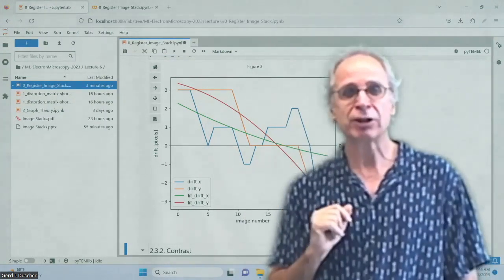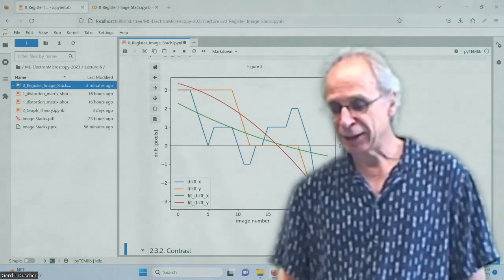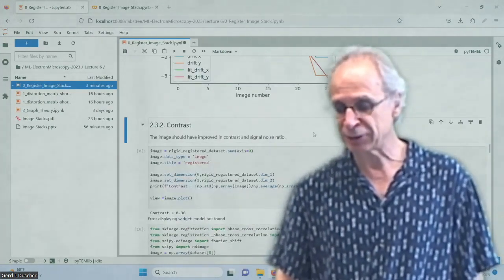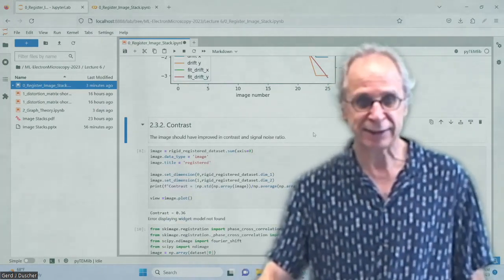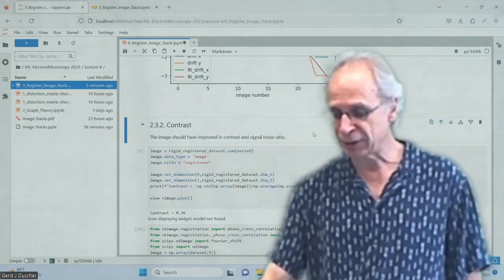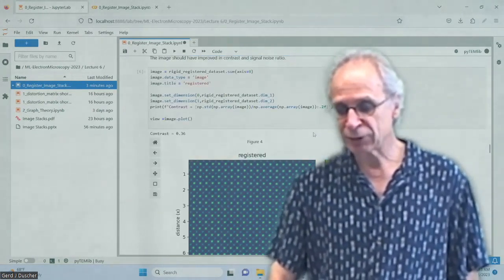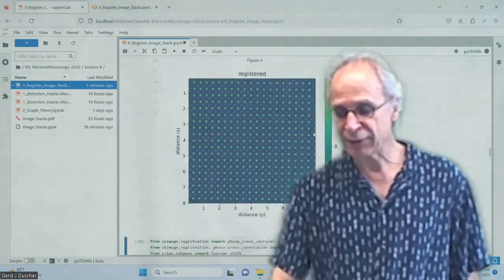That will certainly take you longer than waiting for half an hour on the microscope. So I'm preferring to have a cup of coffee instead of doing a lot of things on the computer. So it's everybody's choice, but the idea is this is a good data set and nobody will complain about that kind of stability. Okay, so after we did that, we can now add that up.